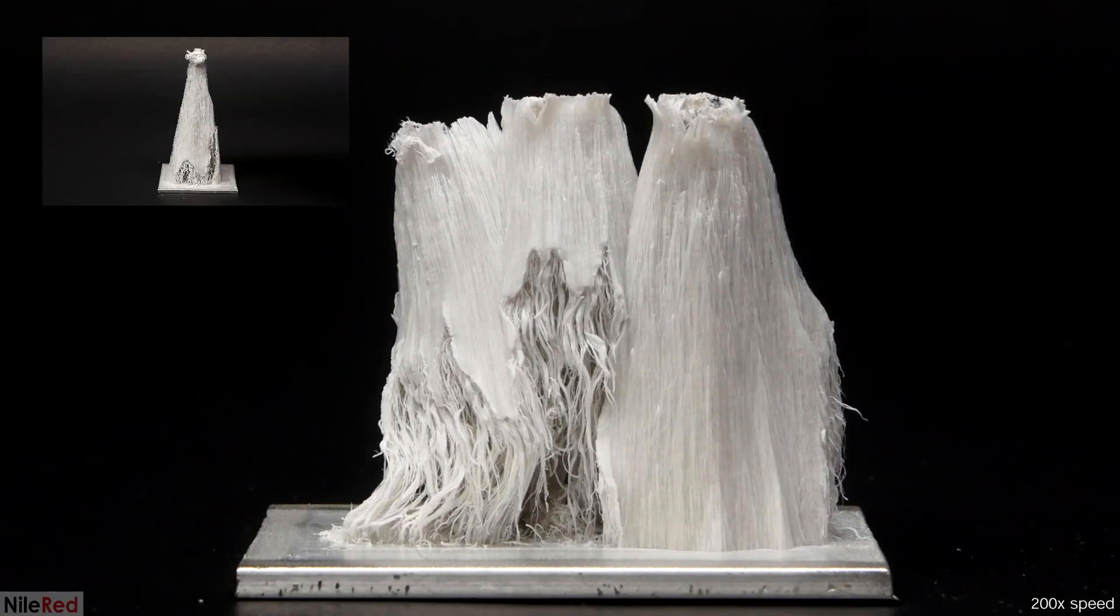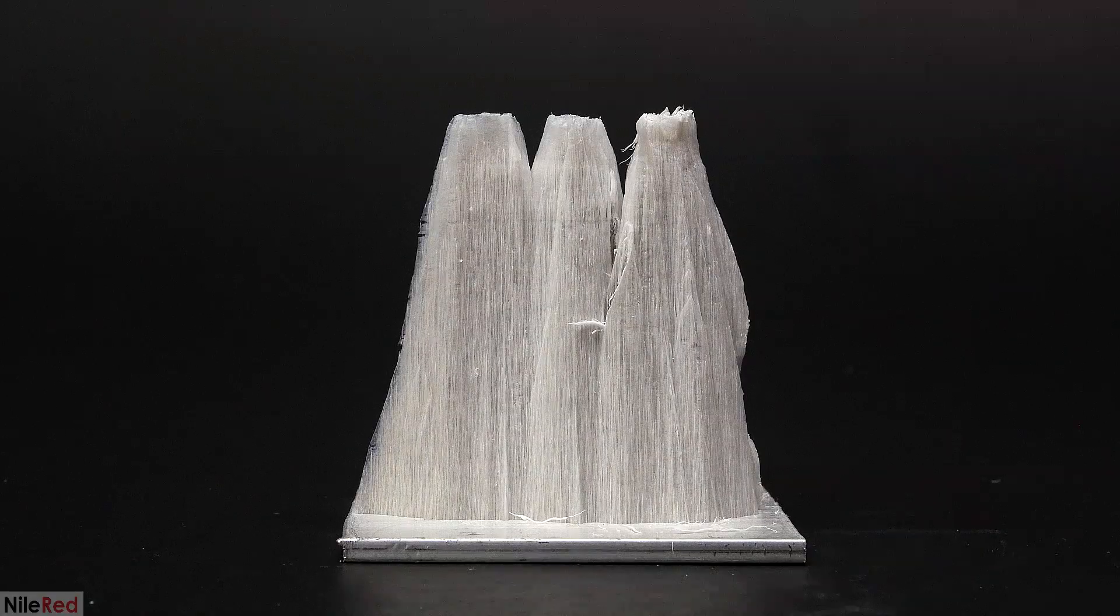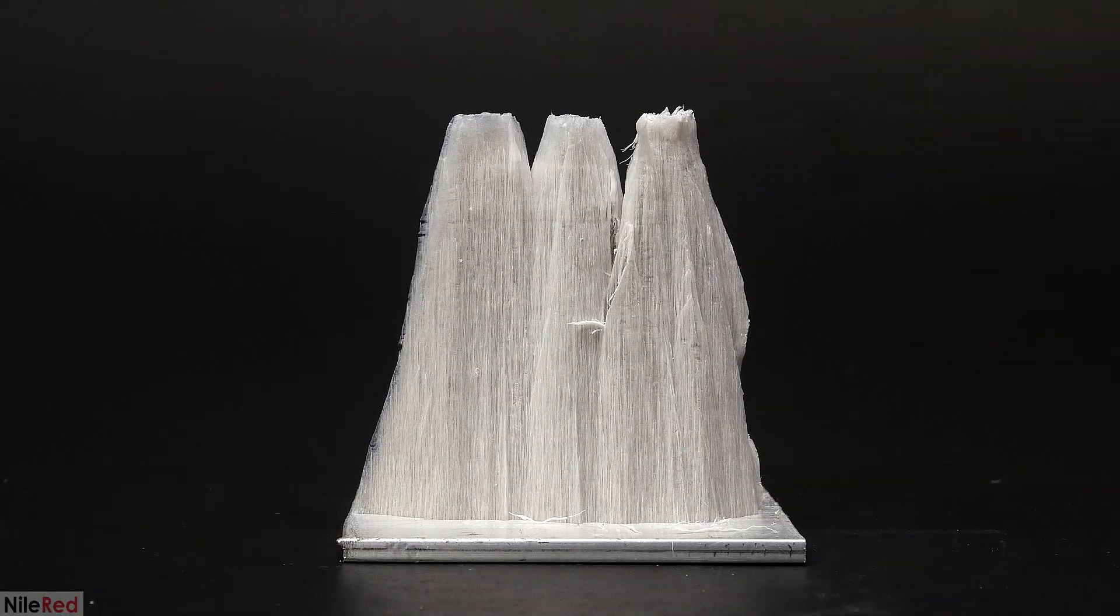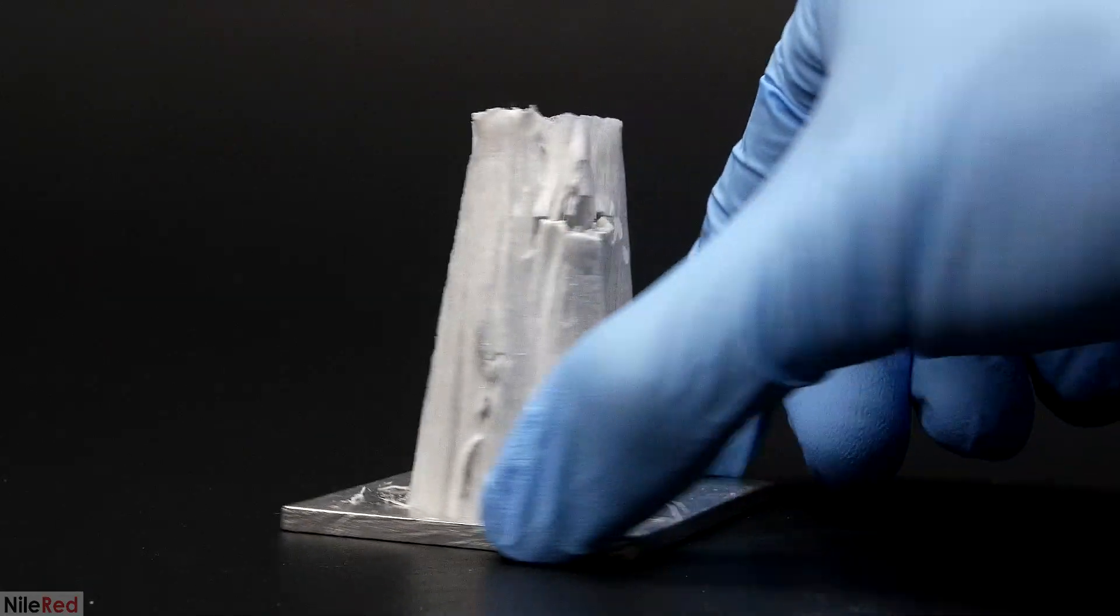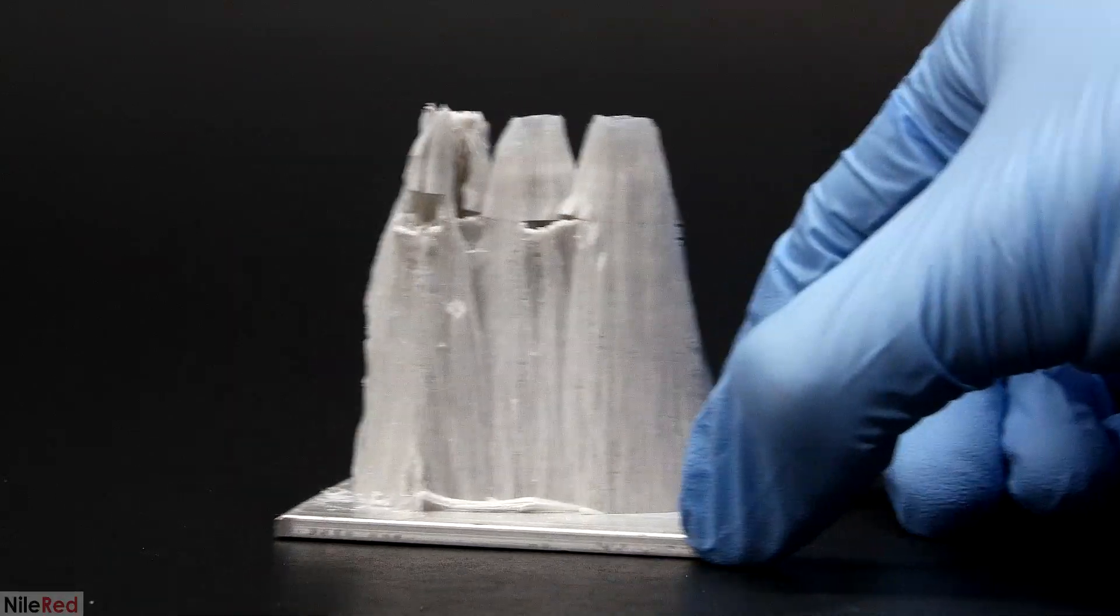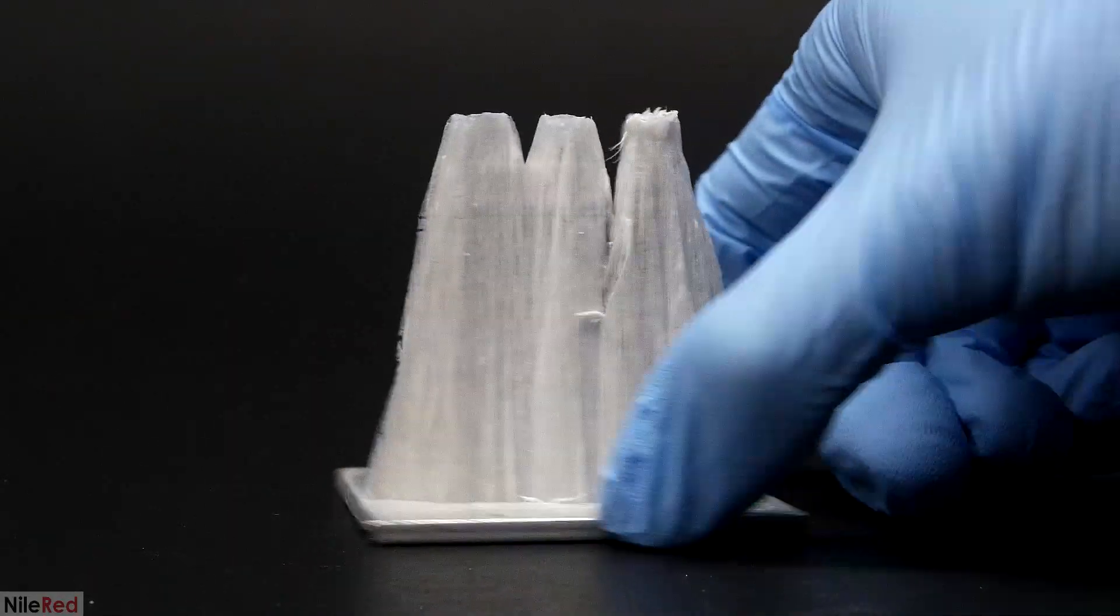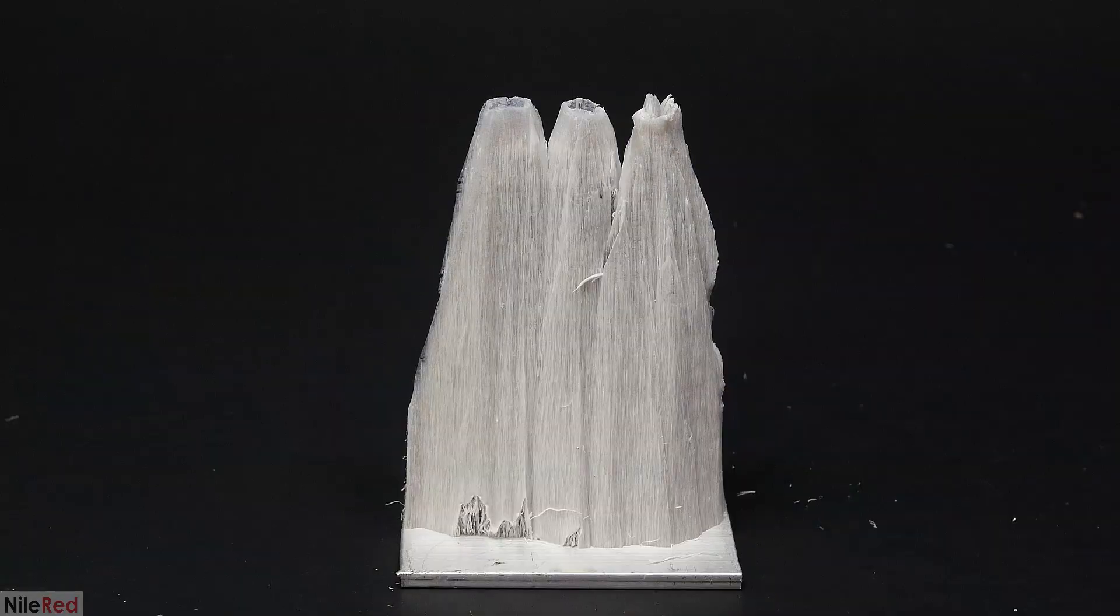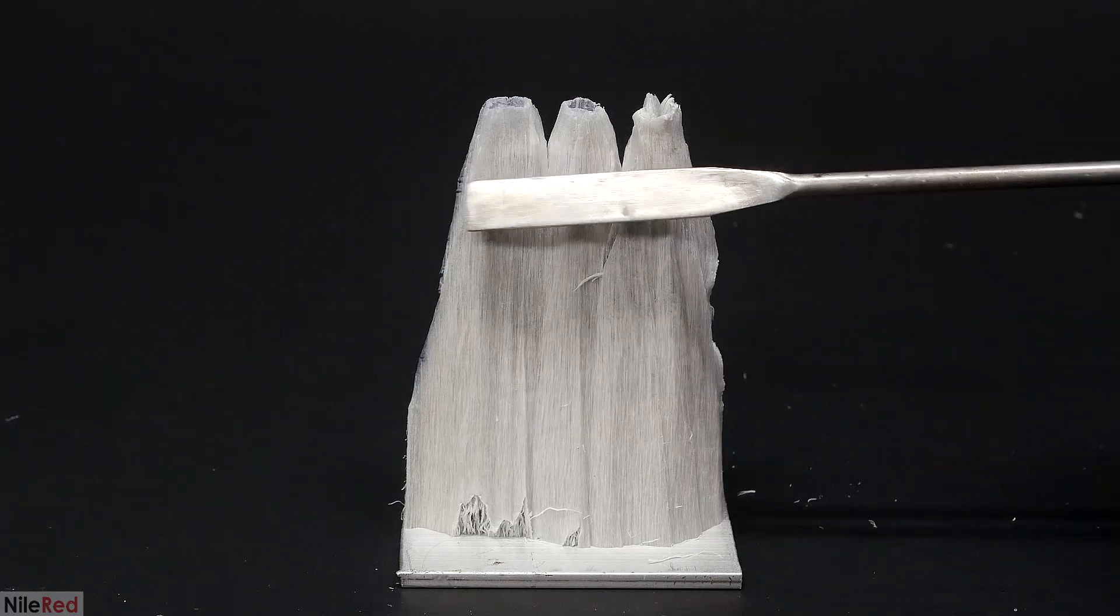I don't think the weakening here is a result of the overlapping towers, and I think it's something that just happens. It even happened with my original one when it was just one tower. I did another run, but I messed up the beginning, so I didn't think it was worth filming it. Oddly enough though, it actually turned out to be a lot cleaner. I don't have a time-lapse, but this is what the final three towers looked like, and it was pretty mundane. It didn't really seem like they cared the other ones were there and they all just merged together.